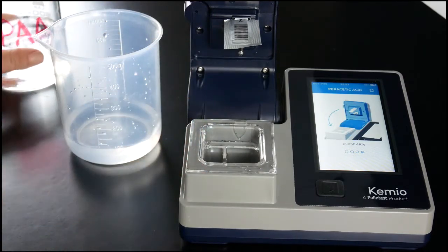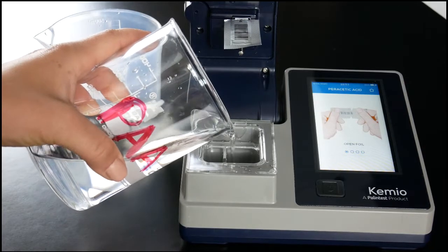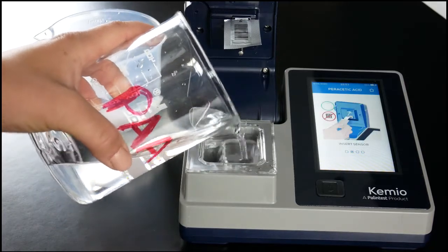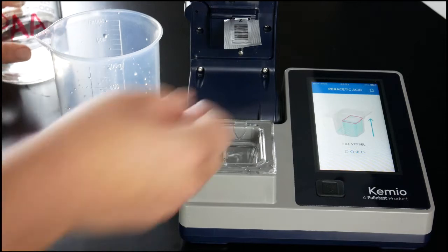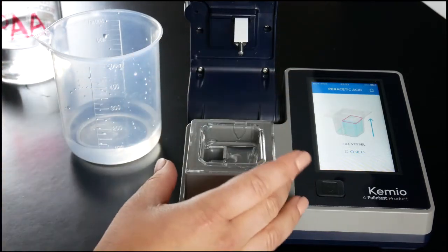Discard and refill up to the notch. Don't worry if it overflows. This is okay and will not affect your results. You may now remove the foil from the sensor and close the arm.